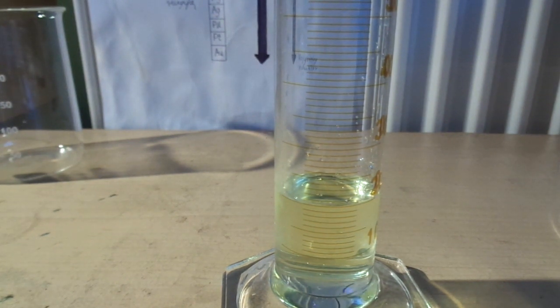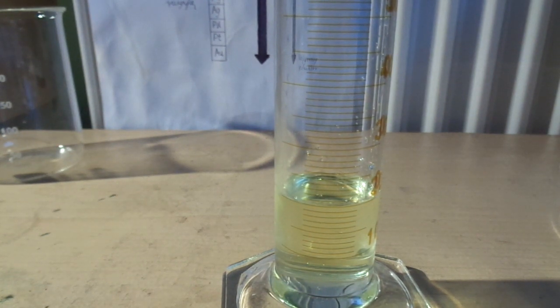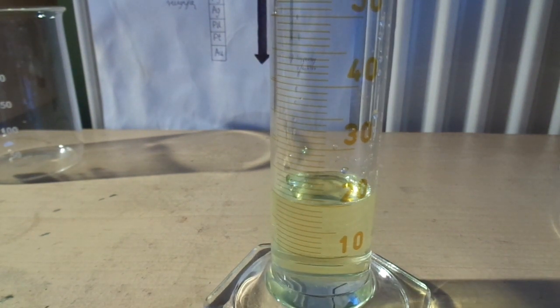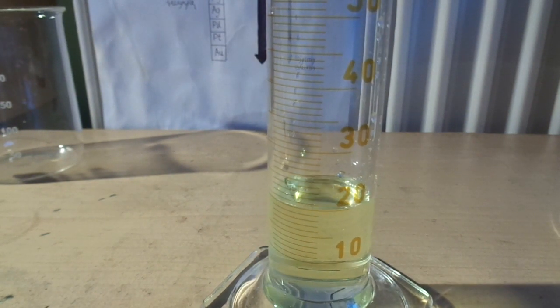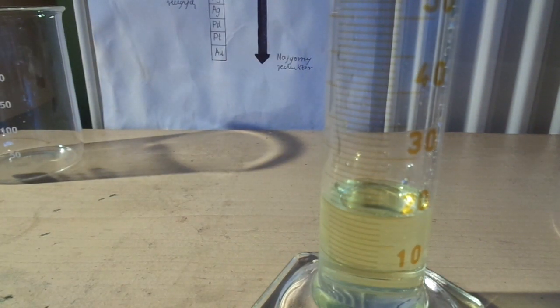But it's technical grade hydrochloric acid. If you have pure hydrochloric acid, definitely use that, but this will also work. 15 milliliters. Okay, I'm diluting it with distilled water.